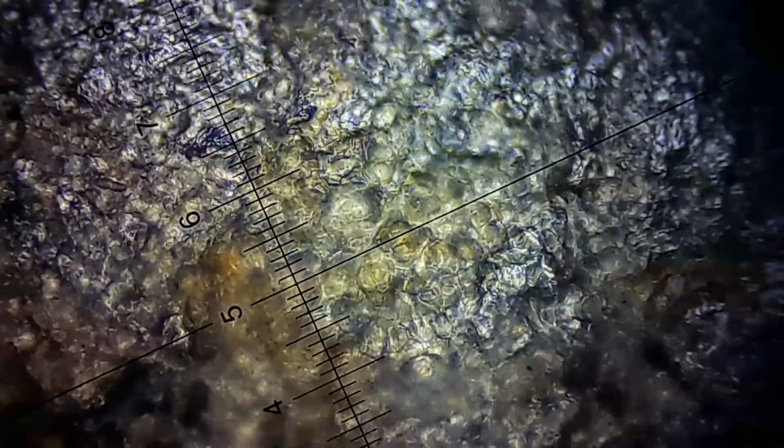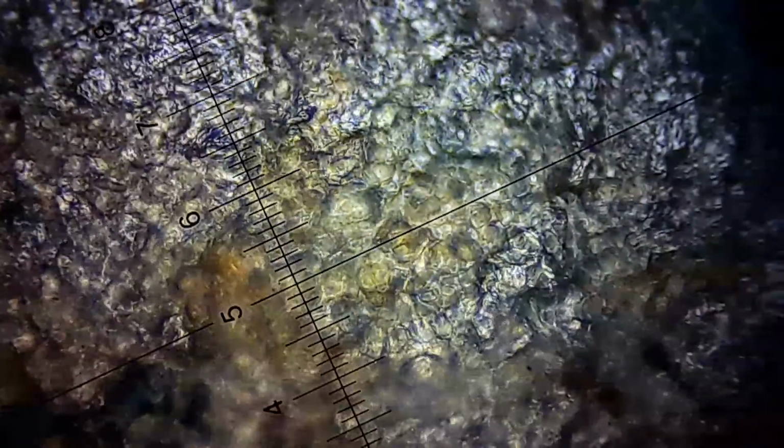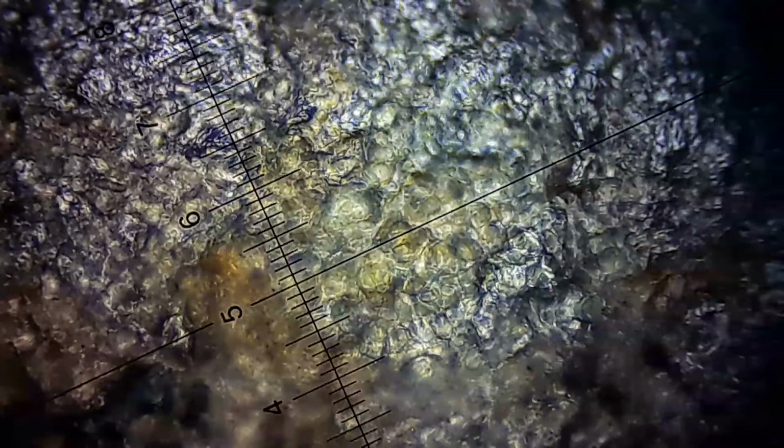Remember why we have depth here in the view: because the piece is not completely horizontal. It's not one thin layer. That's why I see depth. Something near, something far, something not focused, something in focus.